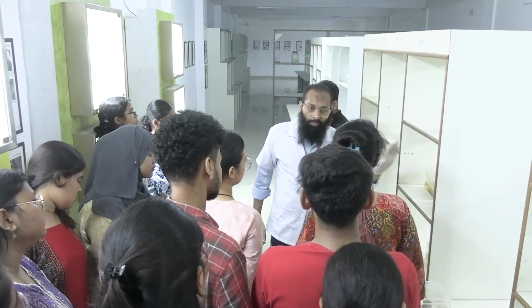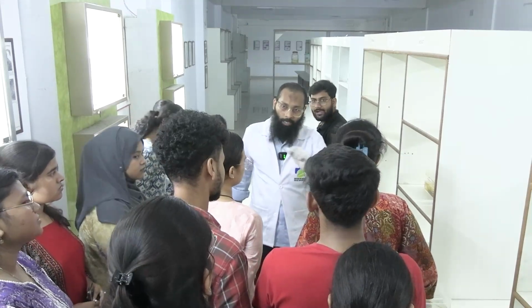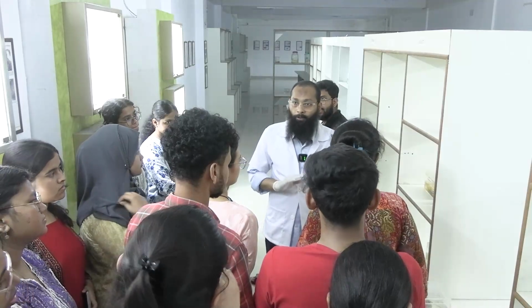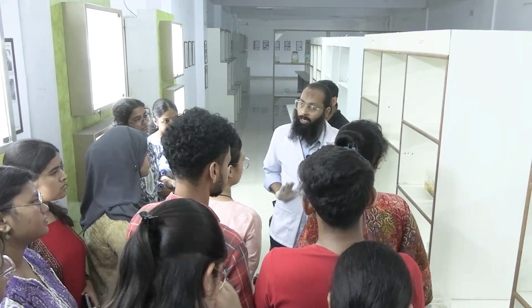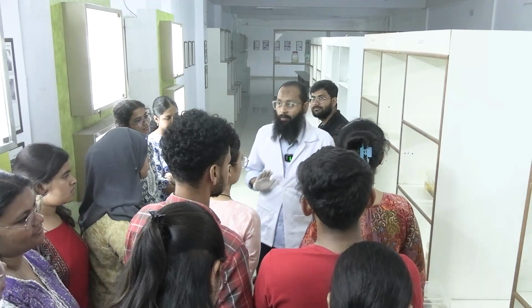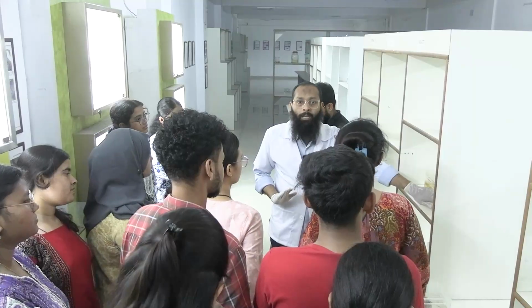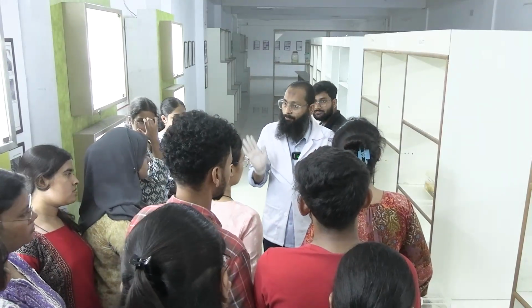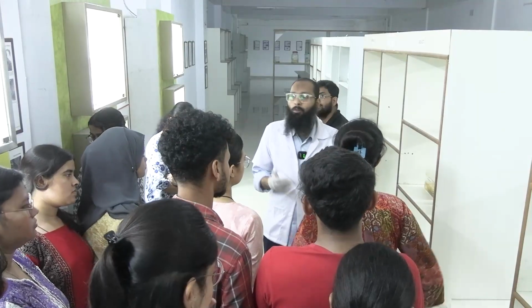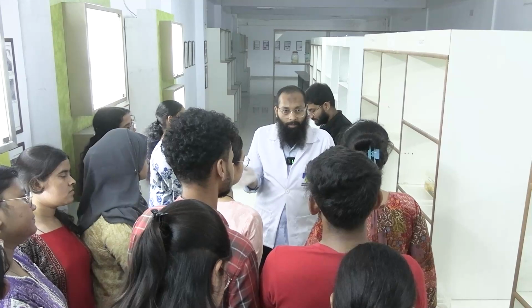So surgical resection margins থেকে সেকশন গুলো নেওয়া হয়। তুমি বলো আর কোথা থেকে সেকশনটা নেবে? টিউমার প্রপার, yes, 4 or 5 sections we take from the tumor proper. আর কোথায় থেকে নেওয়া হয়? Nipple-areola complex থেকে একটা সেকশনটা নেওয়া হয়। আর normal looking area of the breast from all 4 quadrants we generally take. Okay, to look for any premalignant lesions, all those premalignant lesions I have told you.